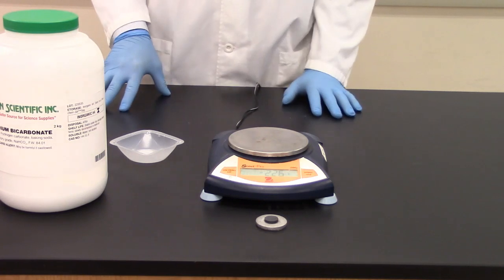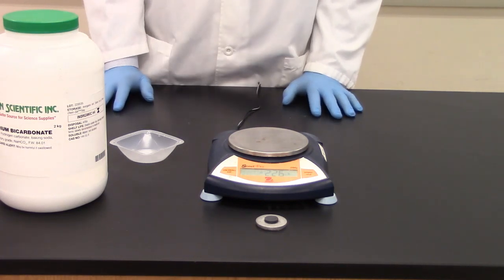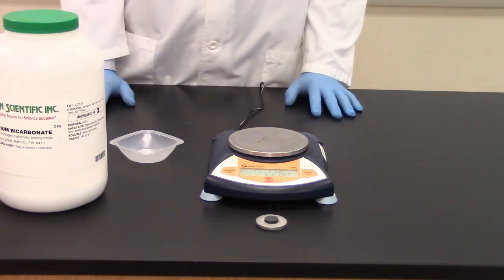Alright, my first step is going to be to measure out a mass of sodium bicarbonate. You decide which mass is appropriate.